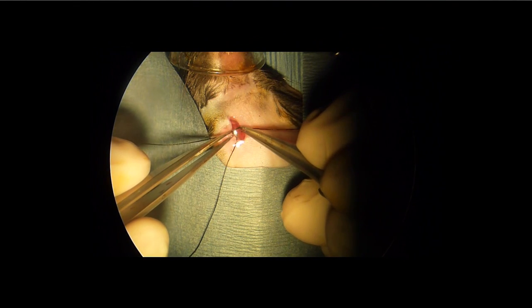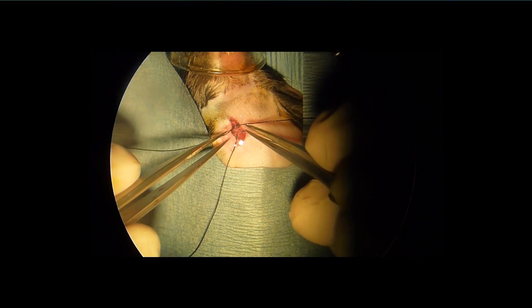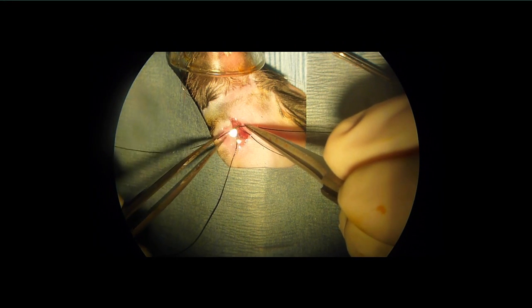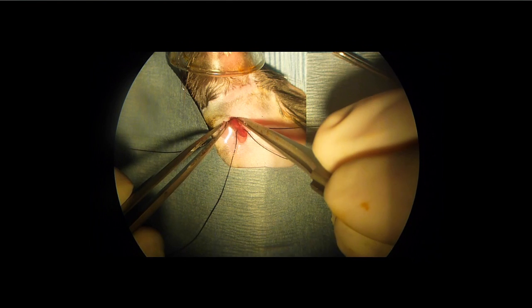Advance as far superior as possible, then ligate the jugular by tightening the knot with forceps.